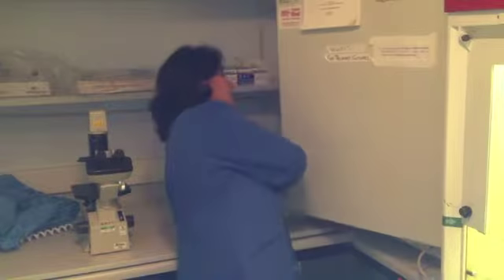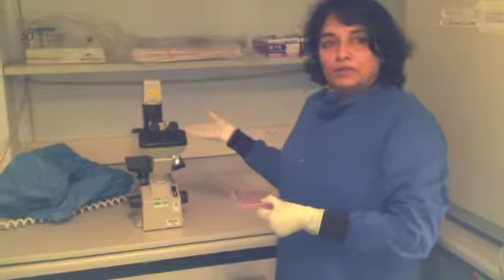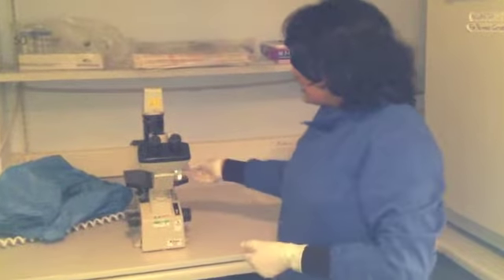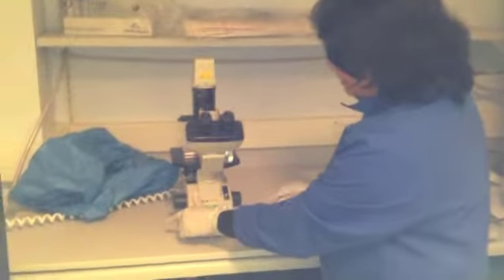Take your plate out and look under the microscope to see if you can see any dark colorations inside the cell. The microscope is located over here. You simply switch it on with the light.